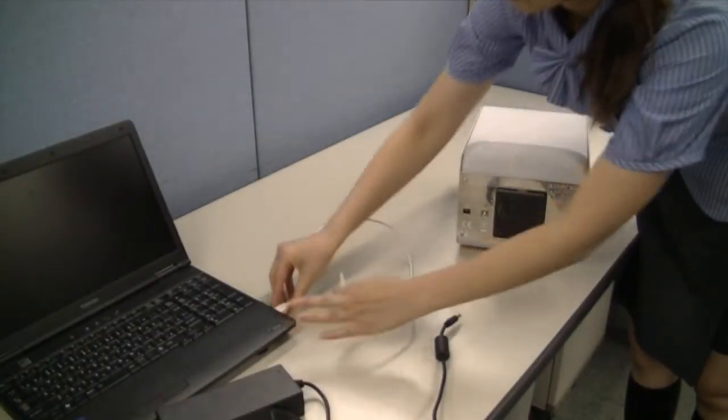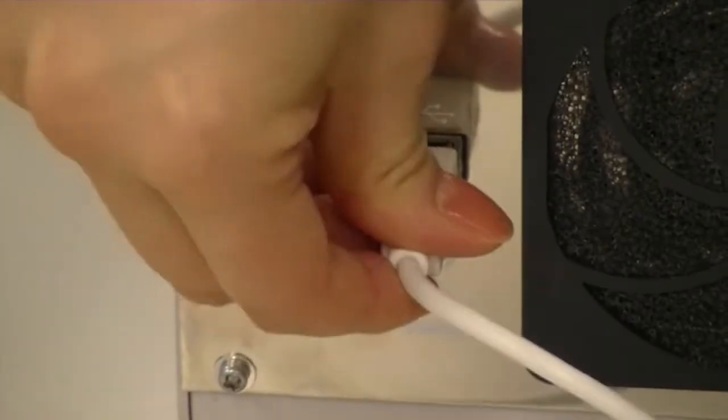It's very easy to set up, just connect the instrument and computer with the USB cable.